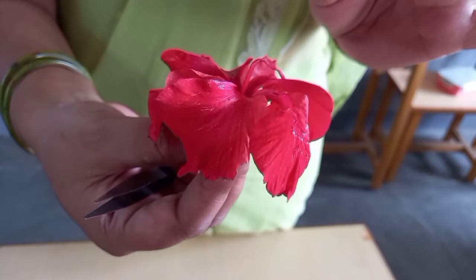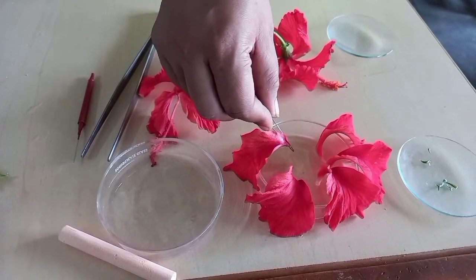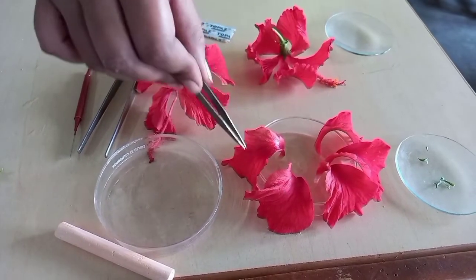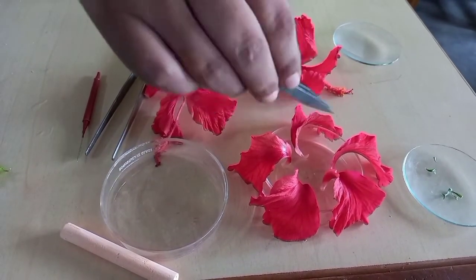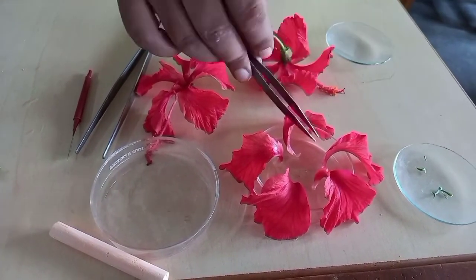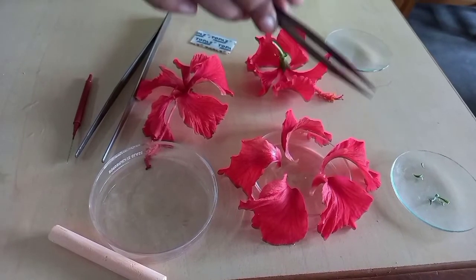Now I am taking out all the petals one by one. Now I have taken out all the petals: 1, 2, 3, 4, 5. So all the petals are here. Single is called petal, and if we take all the 5, then they are called corolla. Now these are two non-essential whorls of a flower, because they do not participate in reproduction.